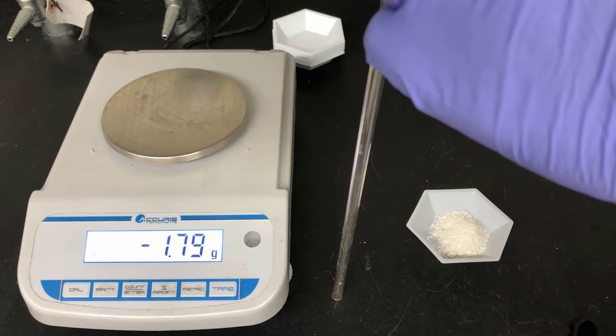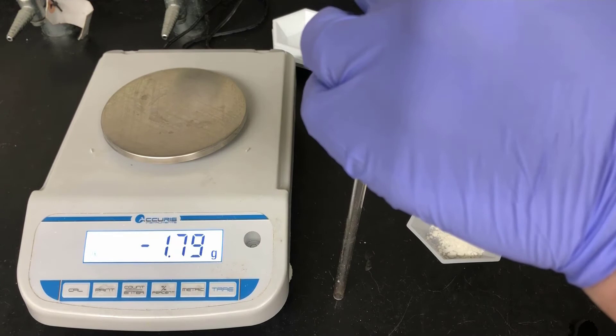Here I'm showing a video of the melting point analysis. This is sped up a bit for the purposes of this video. In real time, it's going much slower than this, rising at a rate of 1 to 2 degrees per minute. Remember to record the melting point as a range, recording the first temperature when you see the first drop of liquid and the last temperature when you see the last bit of solid liquefy.